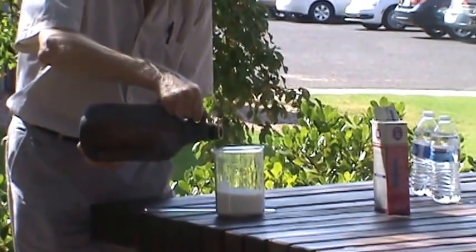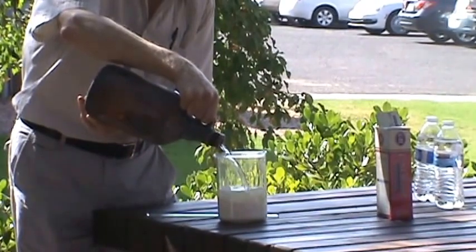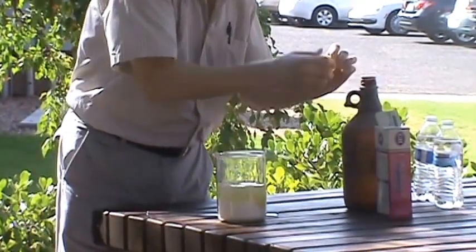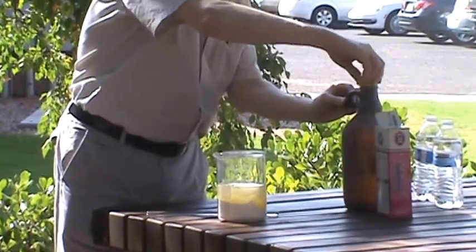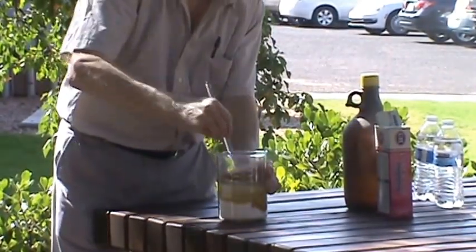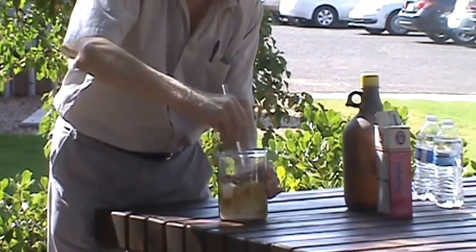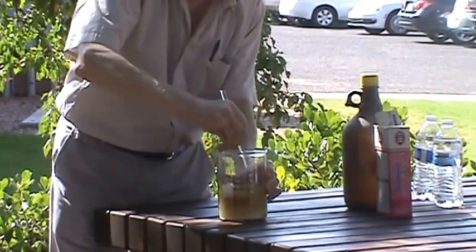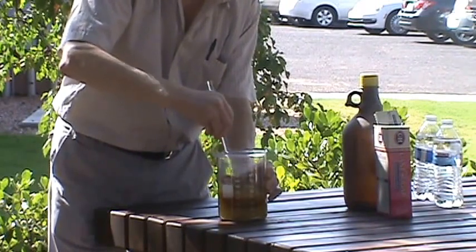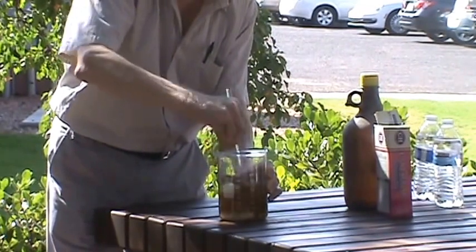I just don't know. So I'm going to pour it in. That should be enough. Then I'm going to stir it with this glass rod. And what you'll see is it's going to turn black because the acid is going to attract the water out of the carbohydrate, leaving behind the carbon.